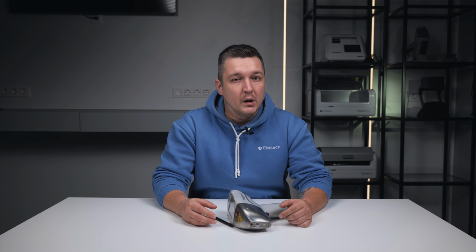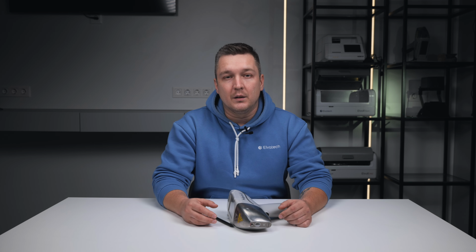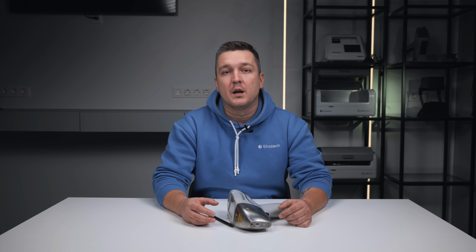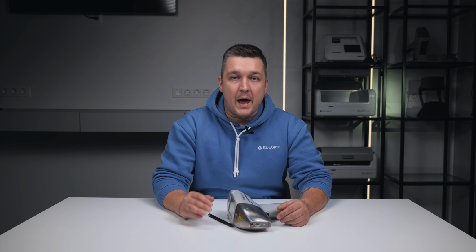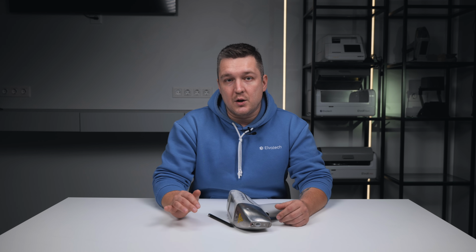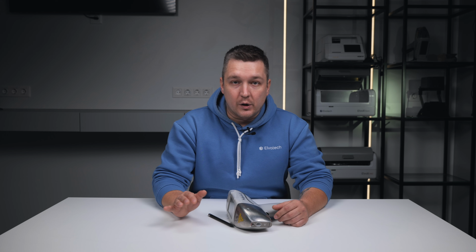And the fourth, make sure you compare with the correct grade in compare to alloy. It's very important to select the correct grade from the library. If you accidentally choose the similar but different grade, the analyzer will honestly show you that something doesn't match. But the problem might be in the wrong reference, not in the material. So always cross-check the expected grade from the documentation and the actual analysis results, and also the tolerances you see on the screen.